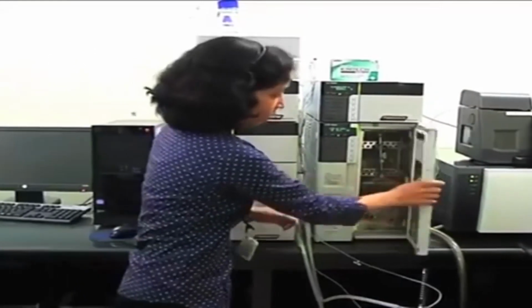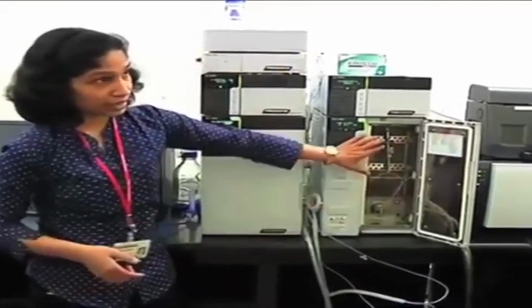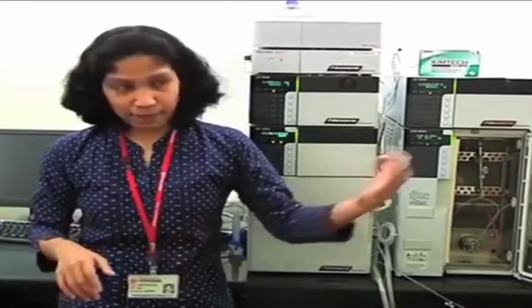Now we will move on to, okay, have you observed that the columns we are using for this analysis, fast HPLC, are fast columns, or UHPLC columns. So these are different from your conventional analytical column. A conventional analytical column will have 150 to 250 mm, 25 centimeter, in length, 4.6 mm ID, and 5 micron particle size. But these columns are fairly short. Their IDs are also low, and the particle size is 2.2 micron or 1.6 micron.